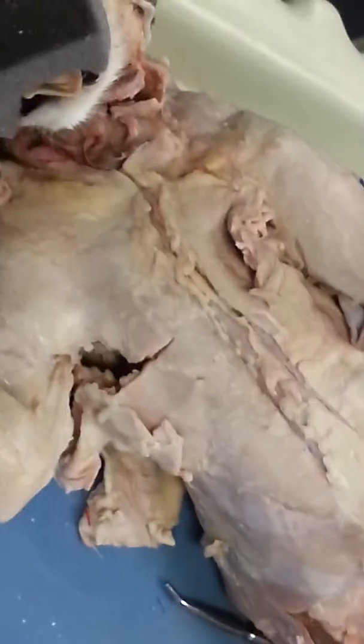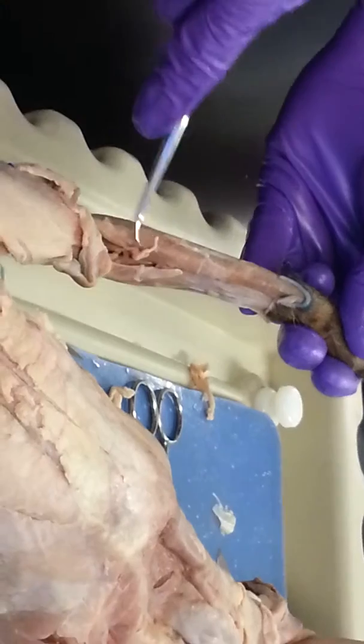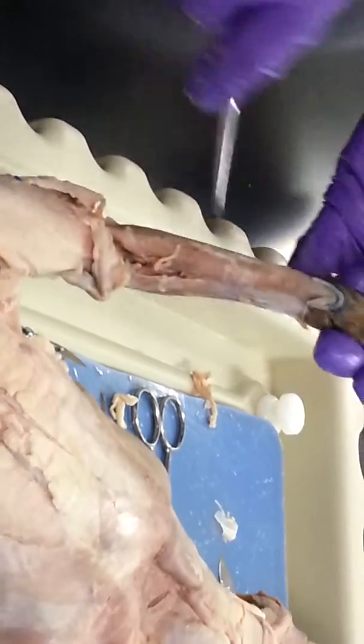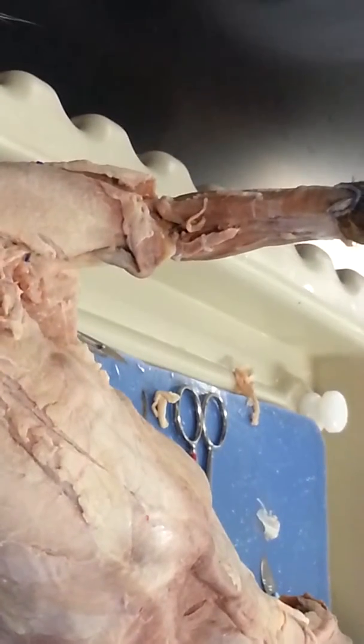What were the two ways you were saying that we could start? Well, I always start at the brachioradialis because it starts at the elbow and it's the biggest one, and then you can basically just go around in a circle around it, or you can start at the elbow and figure out brachioradialis.